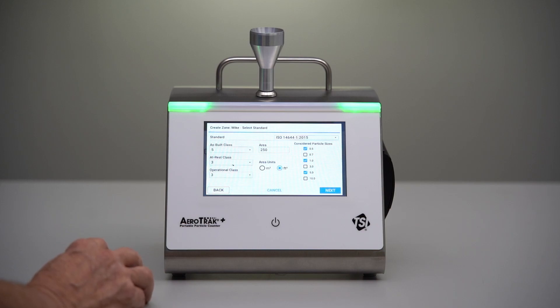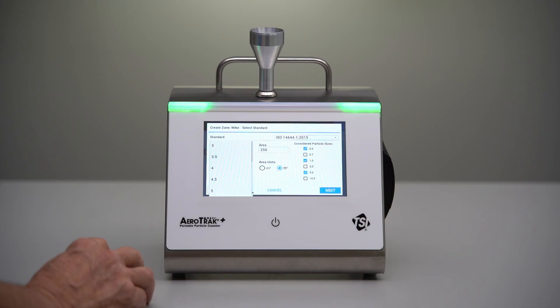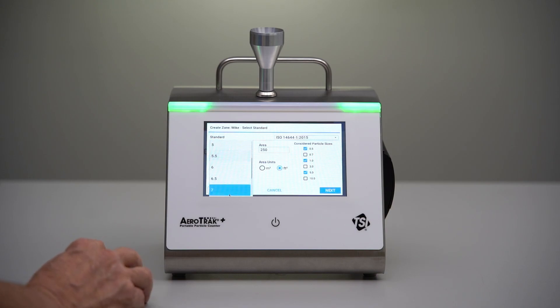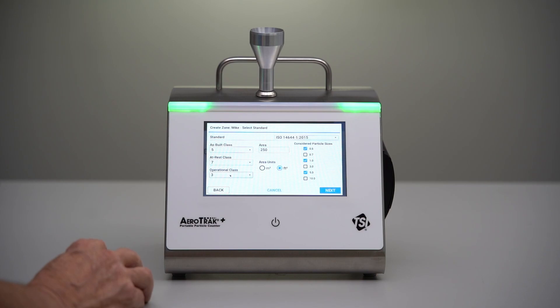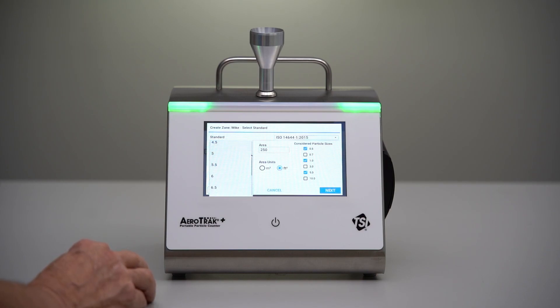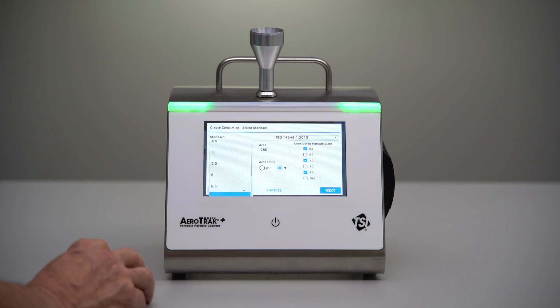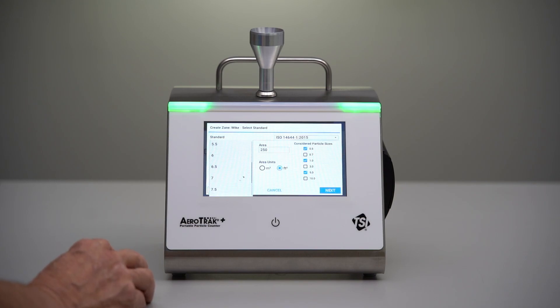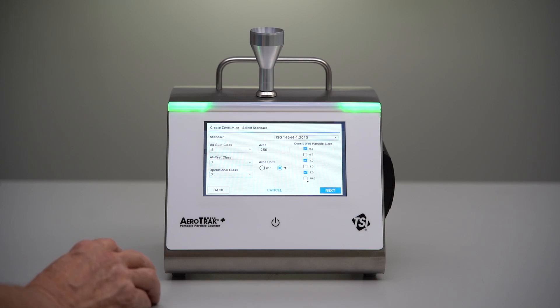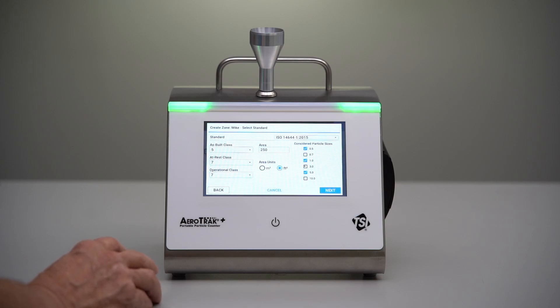I will select Class 5 for as-built, and for at-rest and operational we will select Class 7. The considered particle sizes are based on the standard.